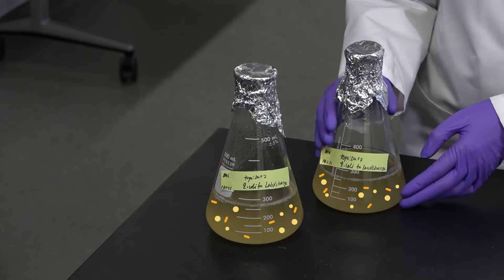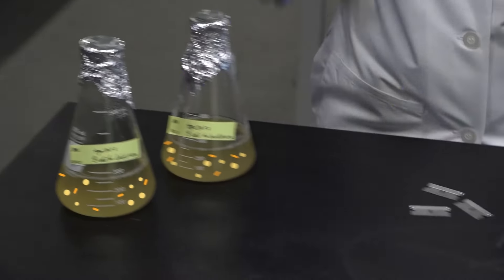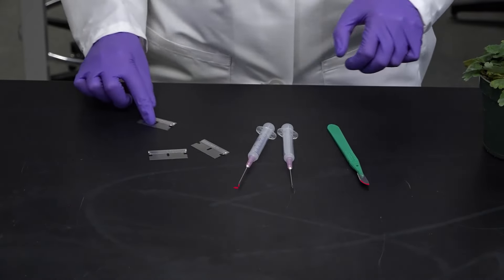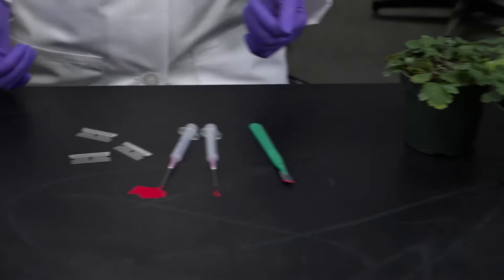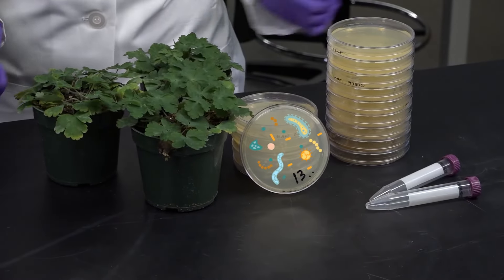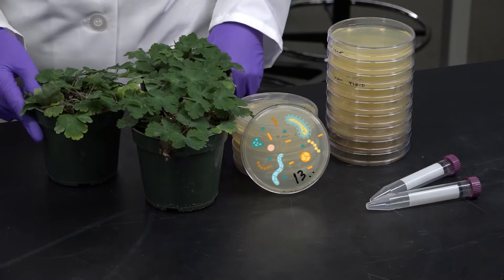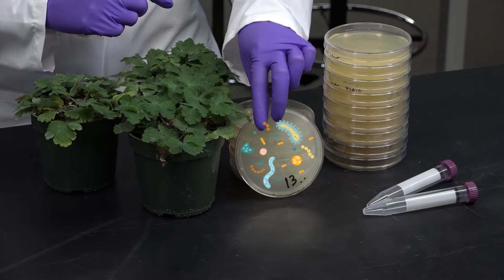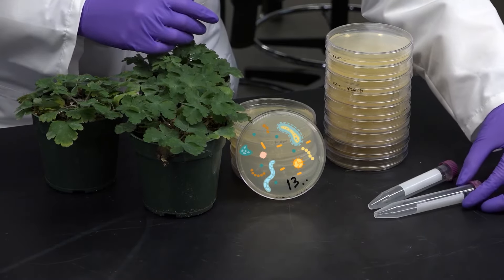Liquids, like blood or bacterial cultures. Sharps, like syringes or blades that have been in contact with pathogens, tissue, or genetically modified materials. And solids — basically anything that's not liquid or sharp. Could be genetically modified plants, microorganisms growing on solid media in petri dishes, test tubes used in bacterial preps, etc.